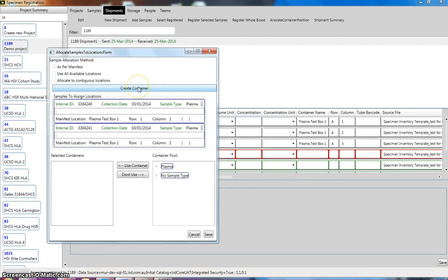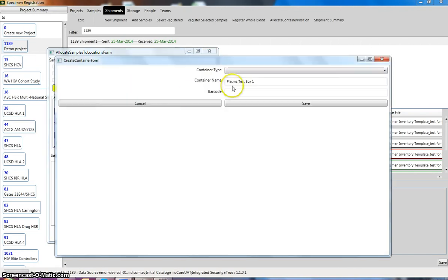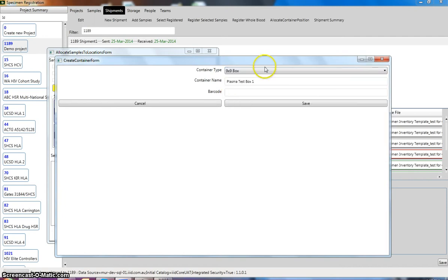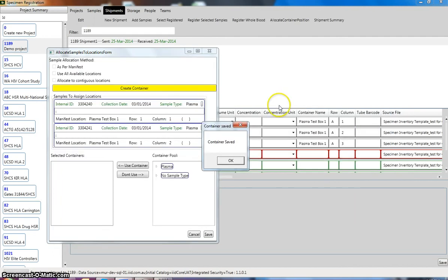And then we go create container. Then you choose your container type, like if it's a 96 well plate, is it going to be a 9x9 box or 10x10? I'm just going to select 9x9 box, and the container name is called plasma test box 1, and you press save, and it will say that the container has been saved, and you click OK.